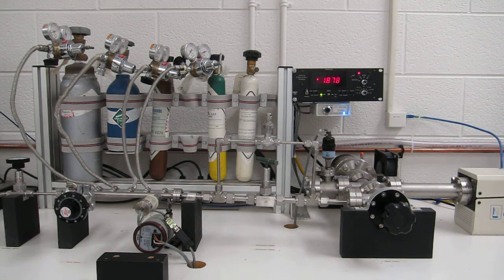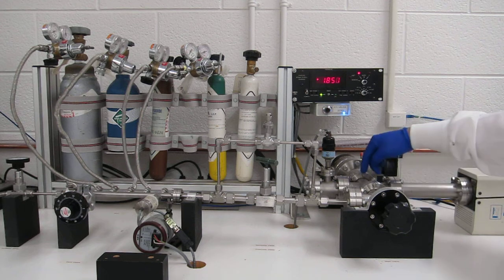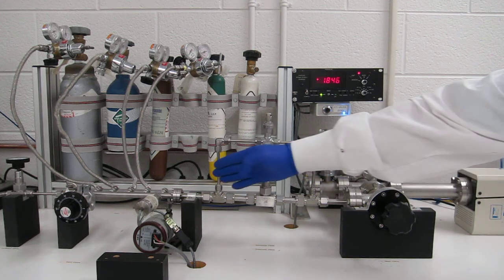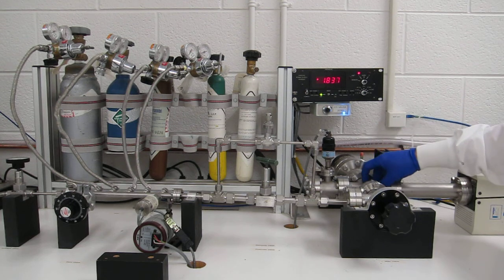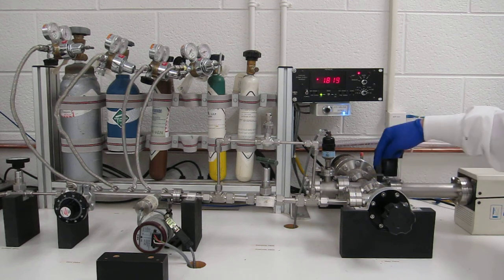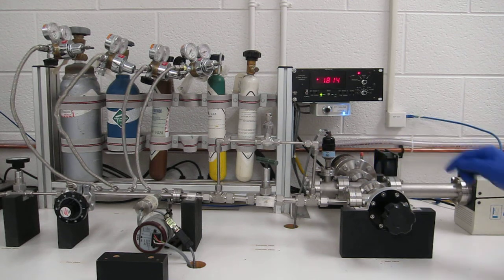Now that we're done with our sample of helium, it's time to flush it out of the manifold and put a new gas into there. Before we do this, we first stop the RGA scan and ensure that the filament of the RGA is turned off. The filament, again, sits right in the path of the gases that are going to be evacuated. If you forget to turn off the filament, it will be exposed to high pressures greater than 10 to the minus 4 torr, and it's quite possible to burn out the filament. So we ensure that the filament is off before we evacuate it.